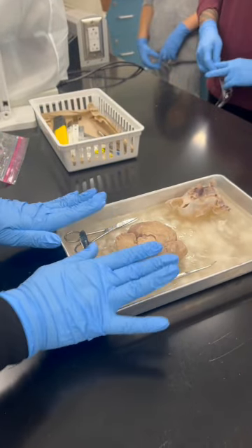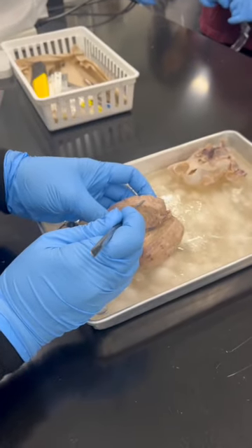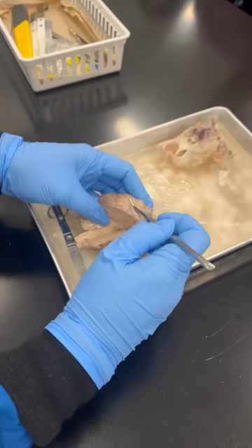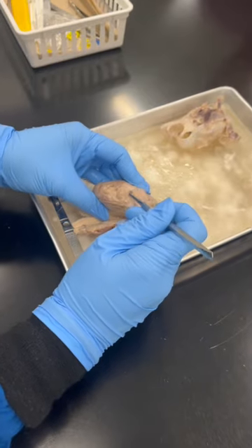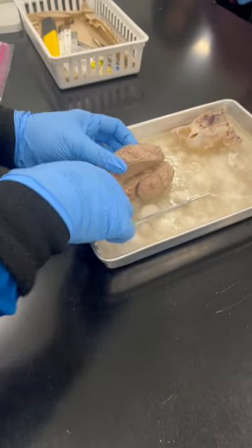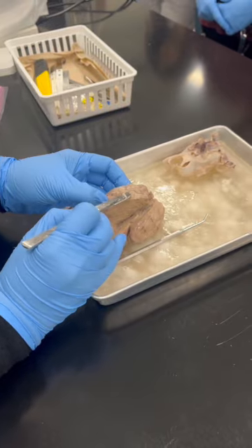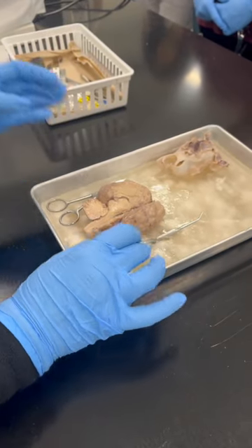This is a dissection. Oh, then the pia mater. What is the pia mater? You would be able to see that this membrane structure is over here. It's very thin, closer to the brain structure. That is called what? Pia mater. So there is a membrane covering here. That is the pia mater.